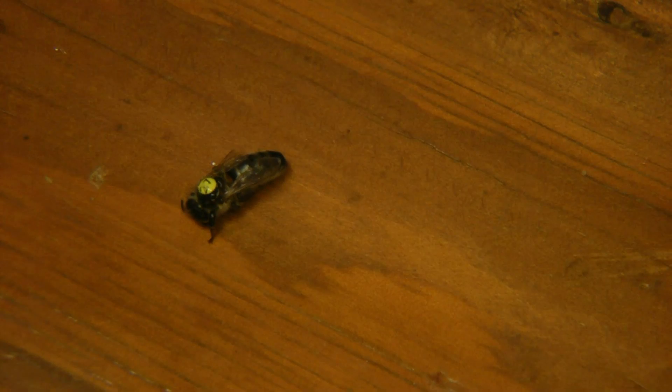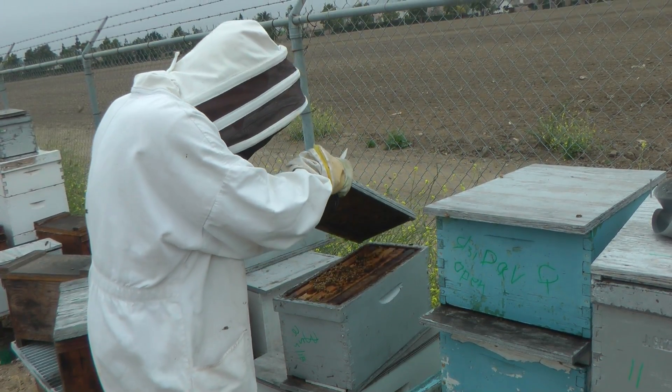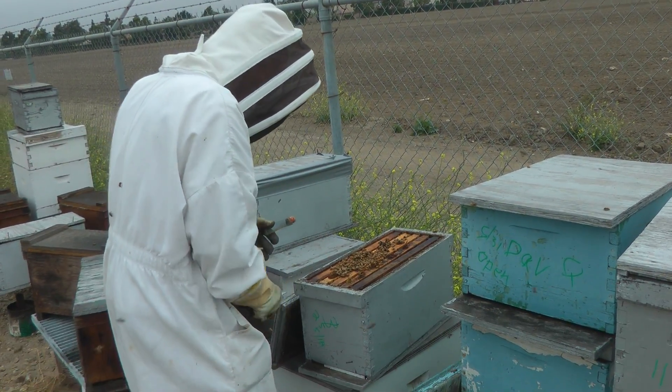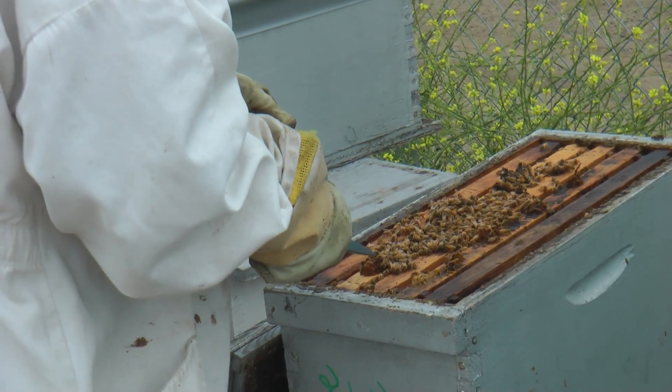Then, if she seems healthy, next day he places her in her future hive, but still in the cage. She will also get another CO2 treatment. This promotes egg production.